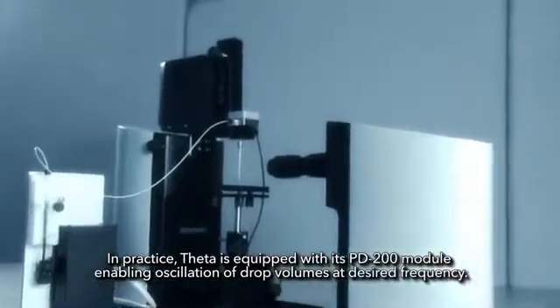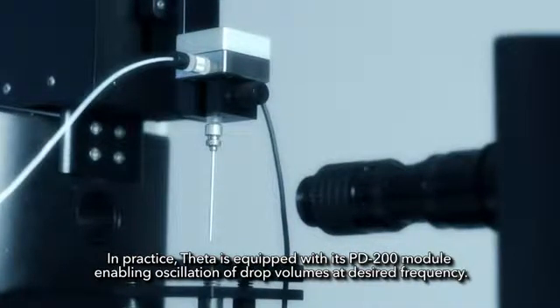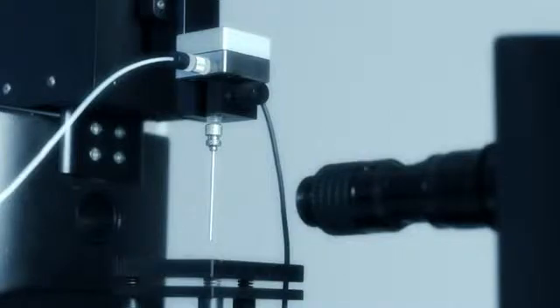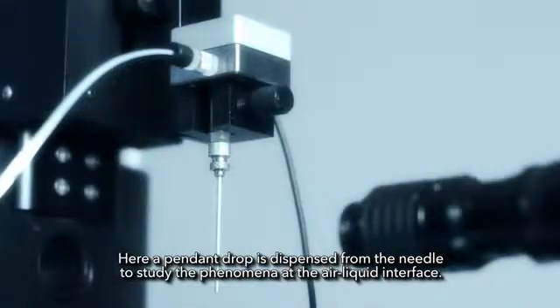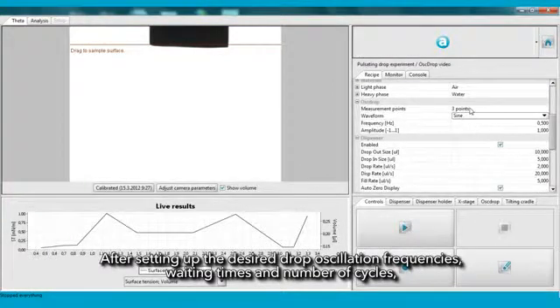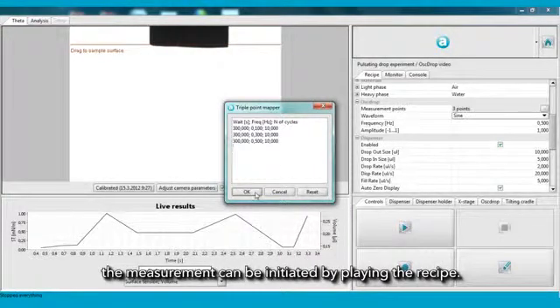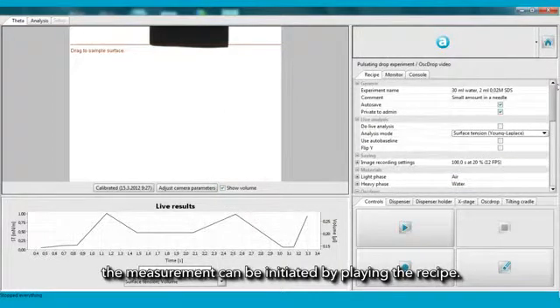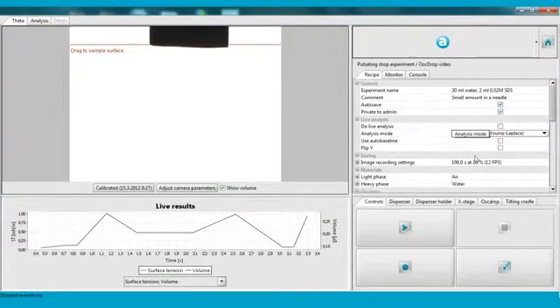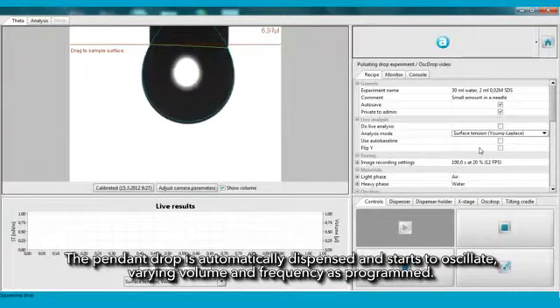In practice, Theta is equipped with its PD200 module, enabling oscillation of drop volumes at desired frequency. Here, a pendant drop is dispensed from the needle to study the phenomena at the air-liquid interface. After setting up the desired drop oscillation frequencies, waiting times, and number of cycles, the measurement can be initiated by playing the recipe. The pendant drop is automatically dispensed and starts to oscillate, varying volume and frequency as programmed.